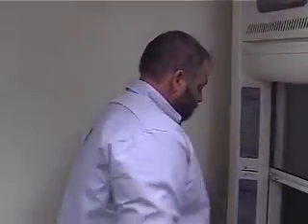Where does this continue to go out at? Up on the roof? I have no idea. Yes, it goes out. And then you do have this purge mode, which is a feature in the labs. Press that, and that'll increase your airflow. Other than that, that's all there is to this thing.